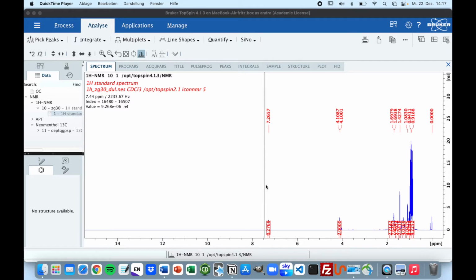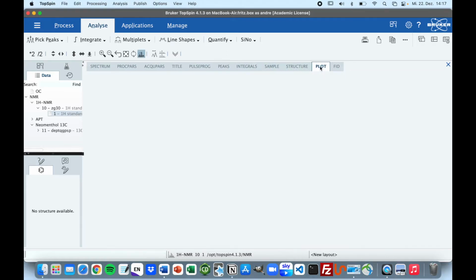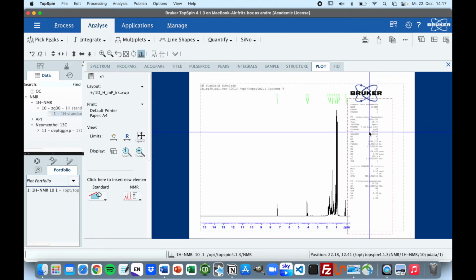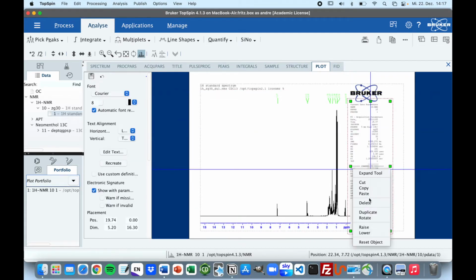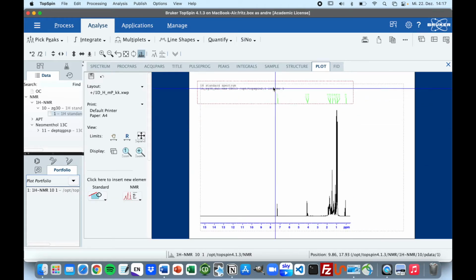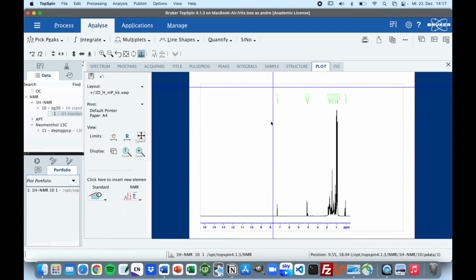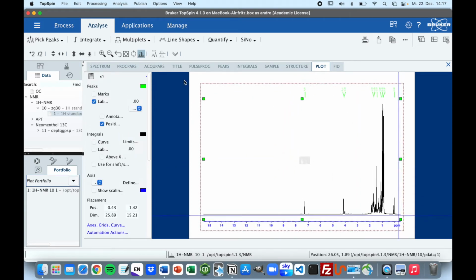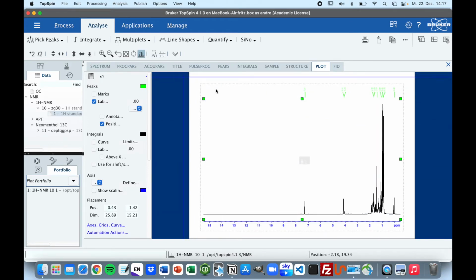So once you have your ready analyzed NMR spectra, the next step is to export it. So what we're going to do is we're going to go to plot, and we'll get an error message, which I will just close. We get these labels we can delete. I don't think they look really professional, so I'm going to just delete them and only leave the spectrum behind. We can expand it into this dotted area, or we can even use the full area here, so later you won't have any space around your image.